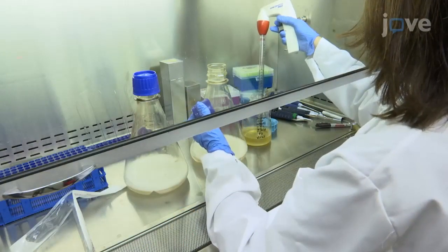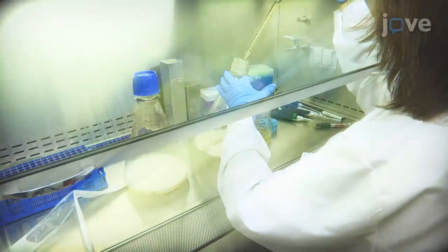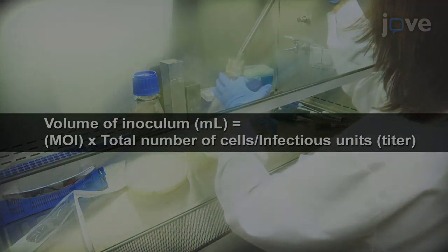Add the P3 baculovirus to the cells at a multiplicity of infection of 5. To determine the amount of virus to inoculate, use the equation shown on screen.